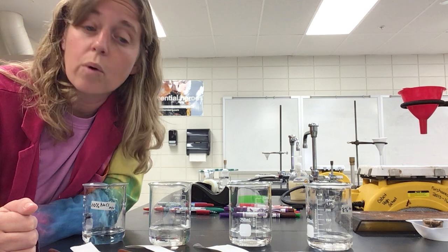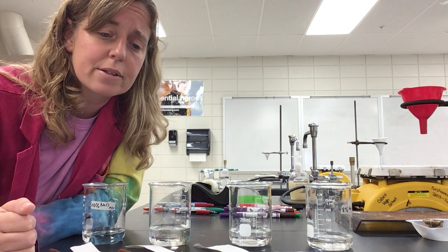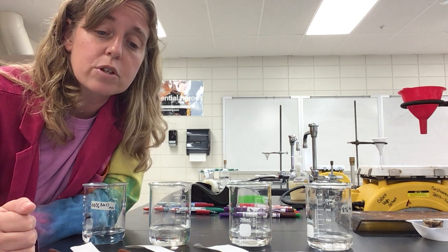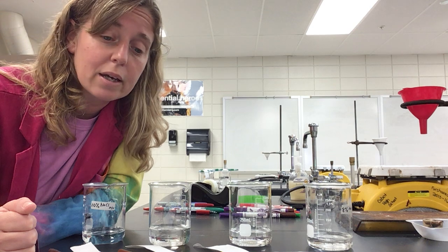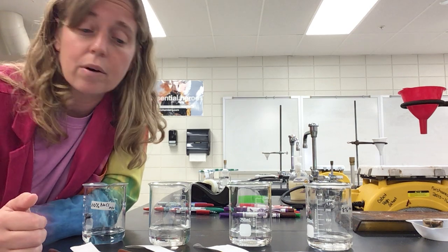Many common inks are water soluble, and they spread apart into their component dyes using water as a solvent. If the ink you are testing does not spread out using water, it may be permanent ink. In such cases, you will have to use a solvent such as rubbing alcohol.